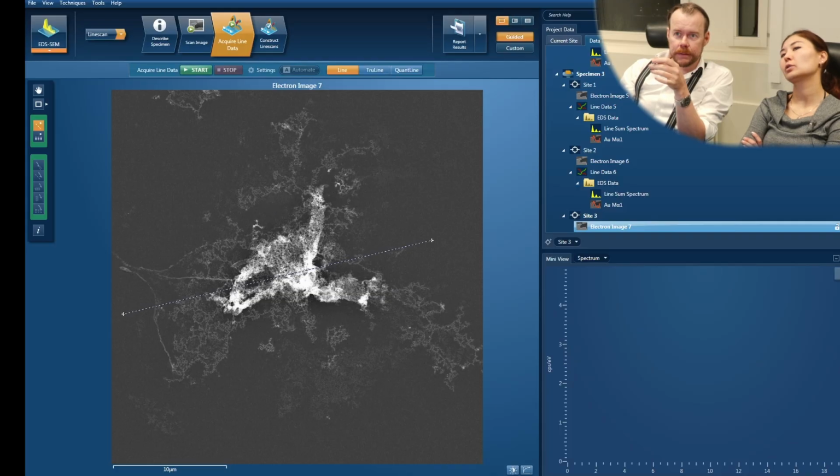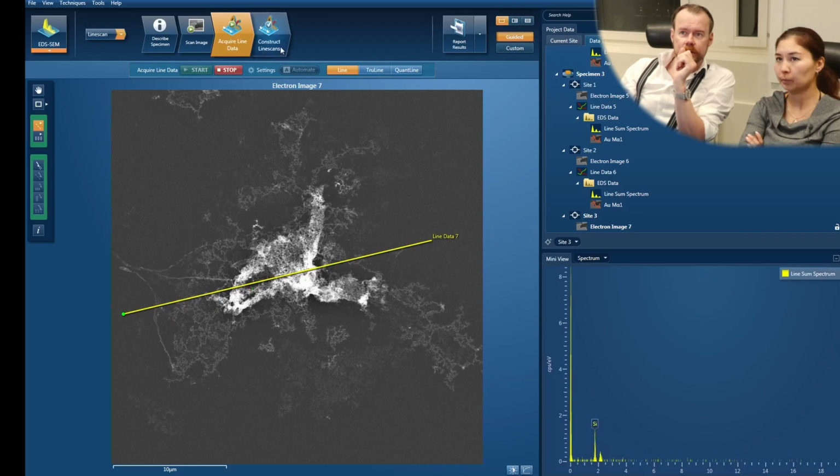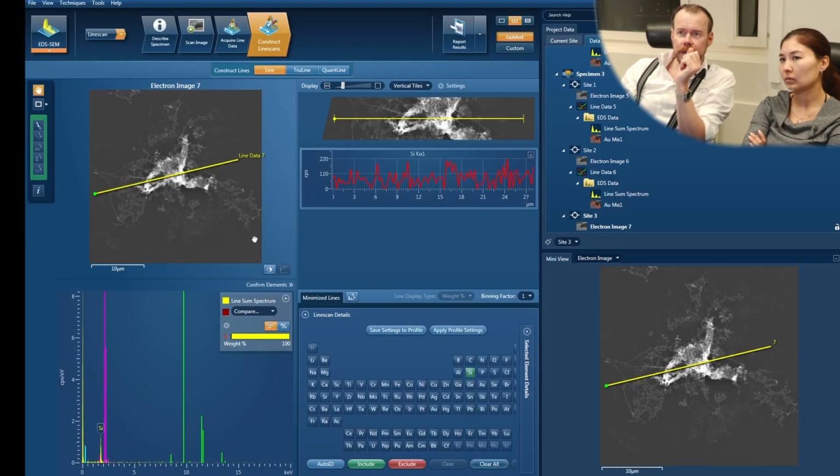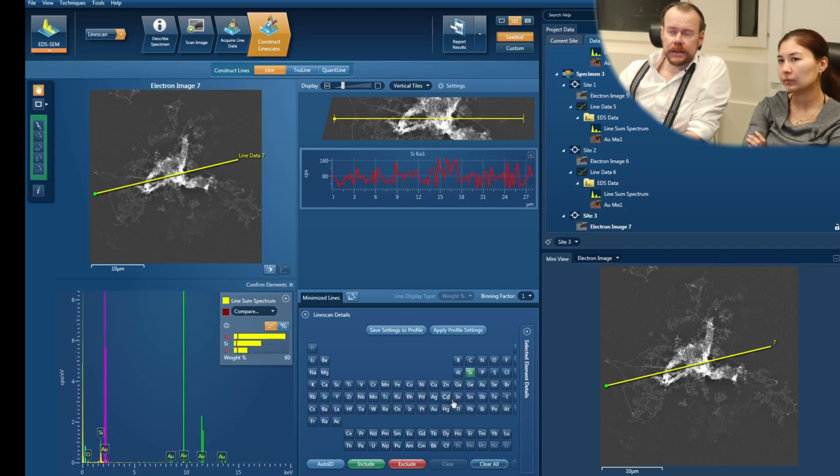How many spots do you have now? The spot size is 4 nanometers. No, I mean the points. 100 points. Okay, so 100 points on the line. Will it be better if you increase? Yeah, you can change that. The idea is it stays at each point and does a measurement for a certain amount of time, and then it moves over to the next point, the next point, the next point.